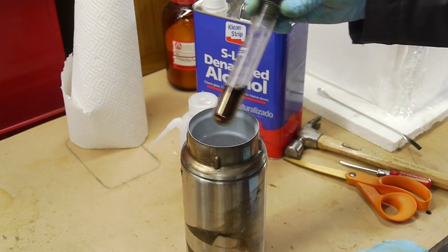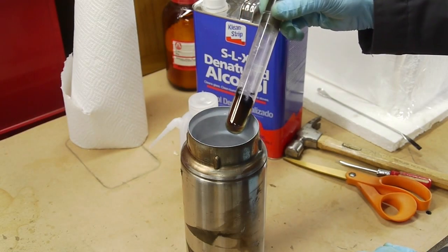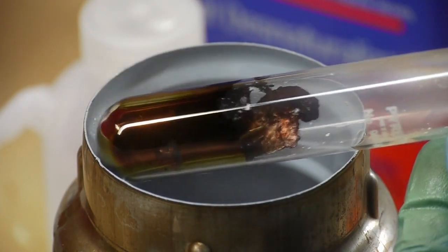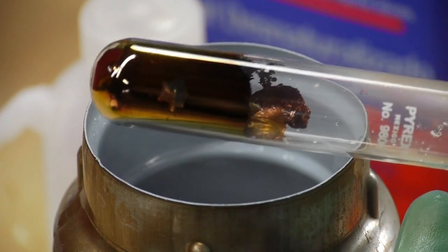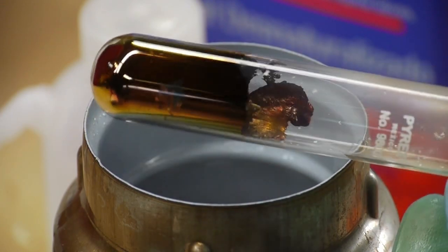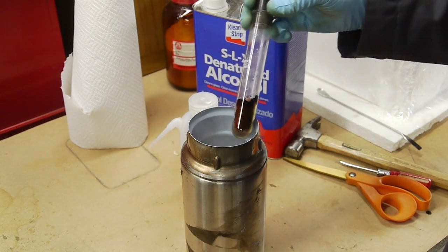So I've seen this one other place on YouTube, and it's actually kind of an unusual reaction to find because it requires some specialized equipment and access to metallic lithium, which I now have.